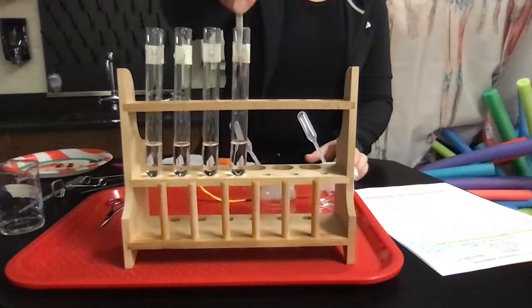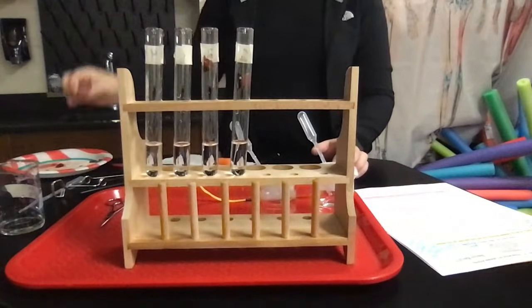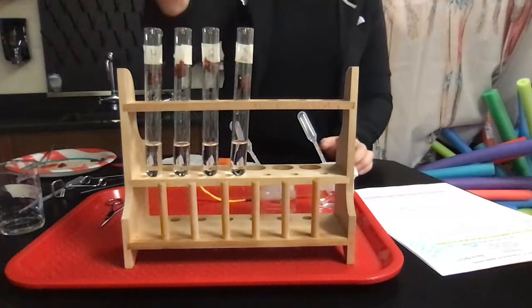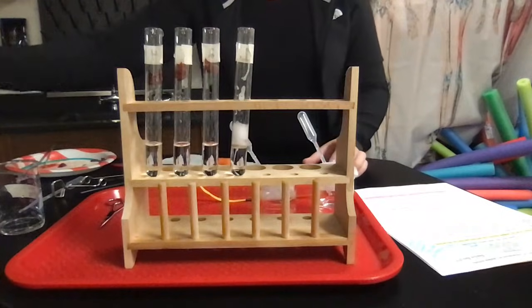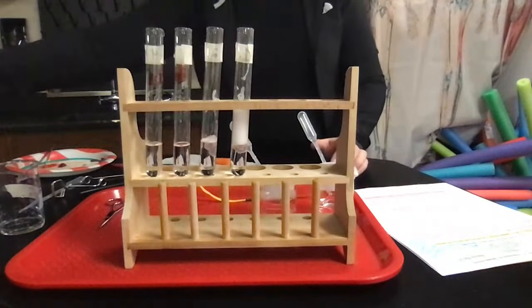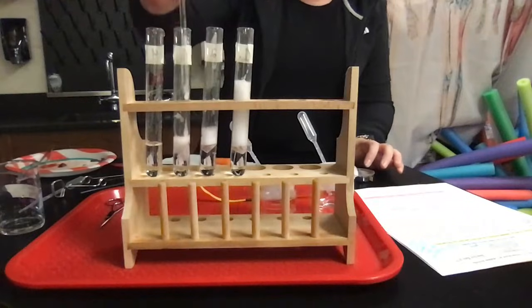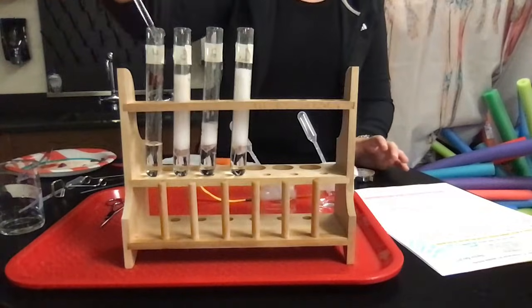I'm just going to shove them in there and then I'll push them down. So we can see the rates of reactivity here. I'm going to rinse this off in between. So I just have it wet with a little bit of water, which is neutral. So again, that one is about a 3. That one was about a 1, or on this it has a 0, which some pH scales have and some don't. That one's very acidic. 3 was a little bit more basic, but close to neutral. And 4 was very basic.